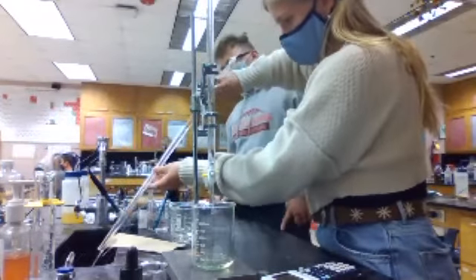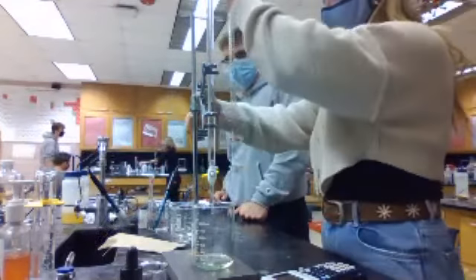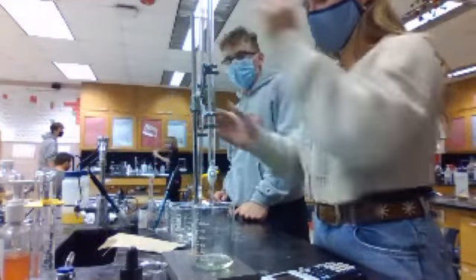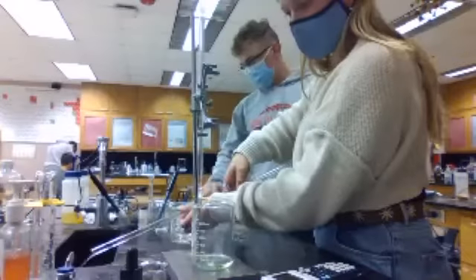Did you guys figure things out? All right, let's go. Good, we drained them. I got for the VA 9.99 and for the VB I got 9.98. Yeah, that's what I got.